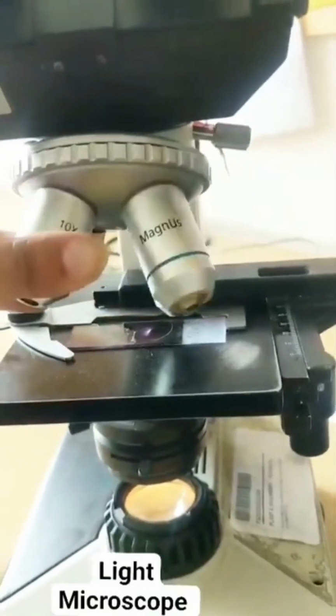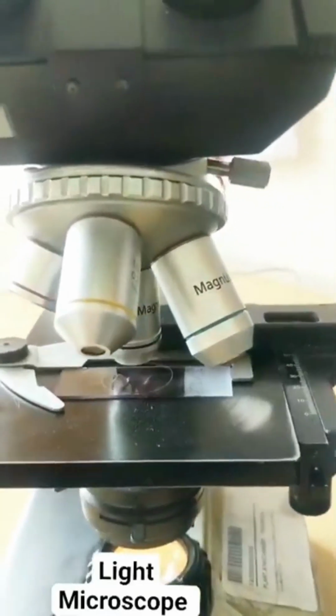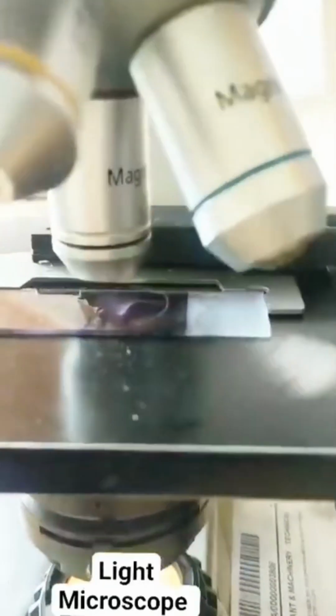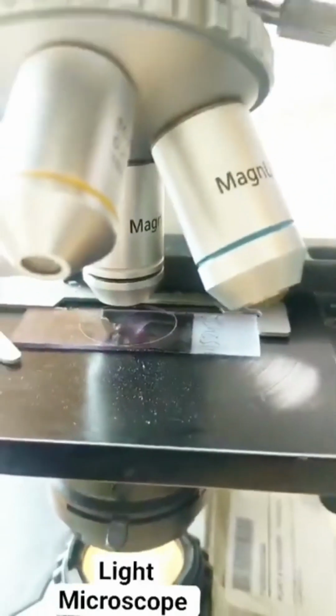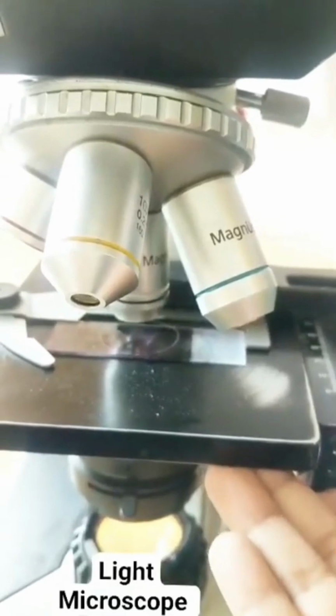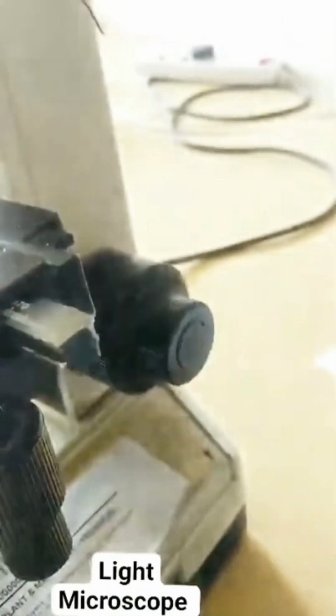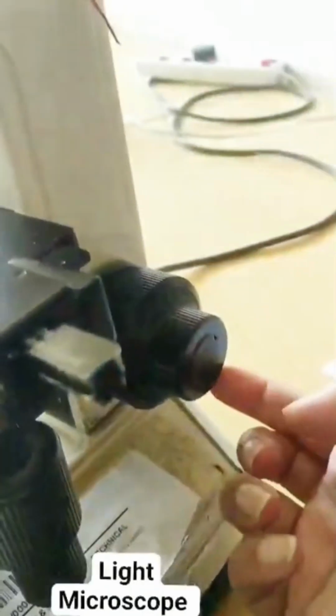Having put that, I will place this lens, but now I see that the lens is not in contact with the oil. So the slide is not in contact with the oil. I need to move this stage. How do I move it? On the side over here, you have these 2 knobs, as you notice. One is the big knob and one is the tiny knob.